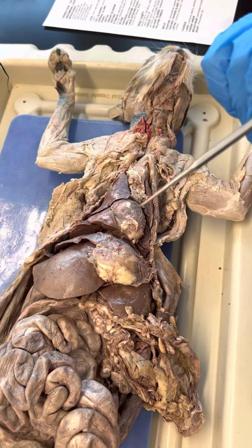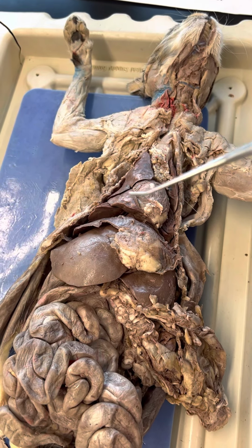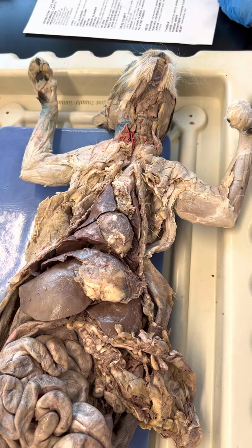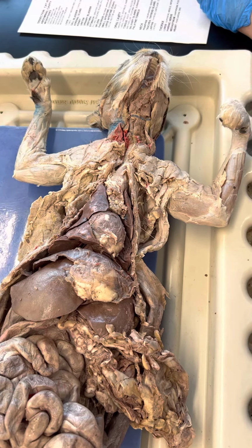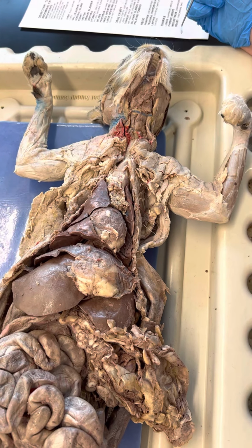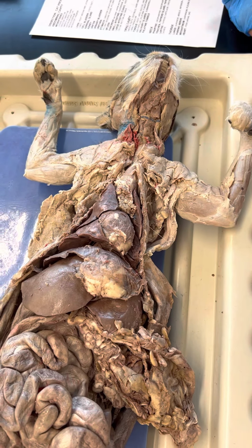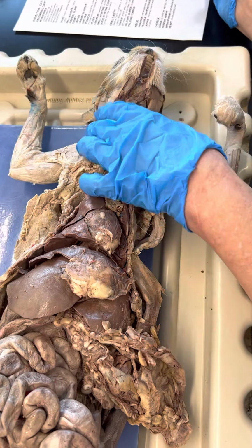Okay, and you have the papillae on the tongue. You have your filiform, fungiform, vallate, foliate. They're just going to be the areas of the tongue. I would just memorize where they are on the tongue. If they're asking for a papillae and they're in that area, you know where they are. That's a memorization thing, because it really would be hard to distinguish them here. Salivary glands: submandibular, parotid, sublingual.